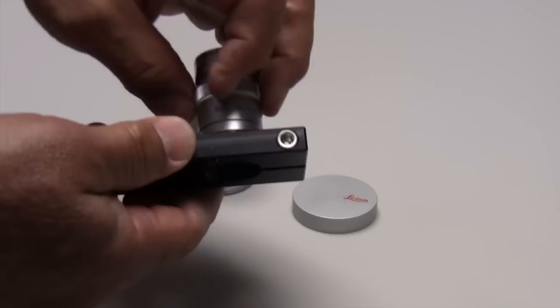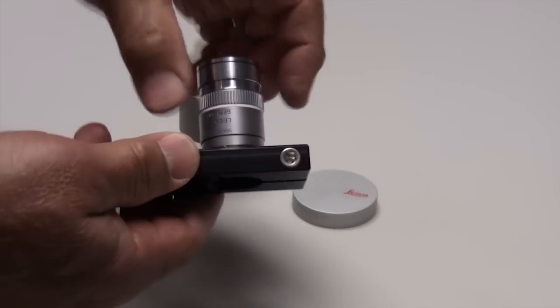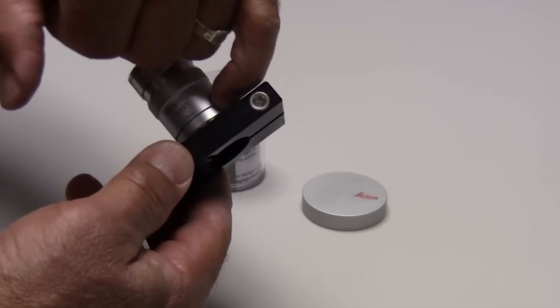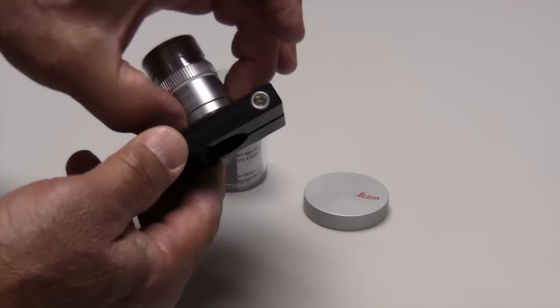In this case, what we're going to do is only screw it in a couple rotations, a couple threads, leaving a little gap here at the bottom so that there's room for the sleeve to pop off.